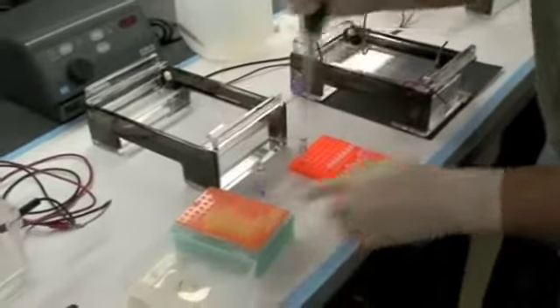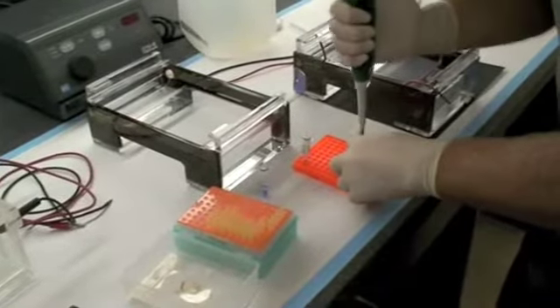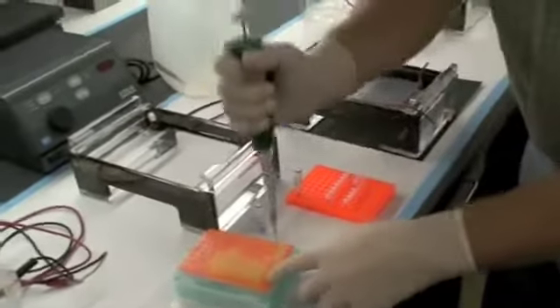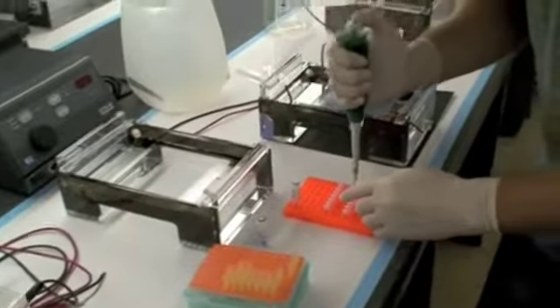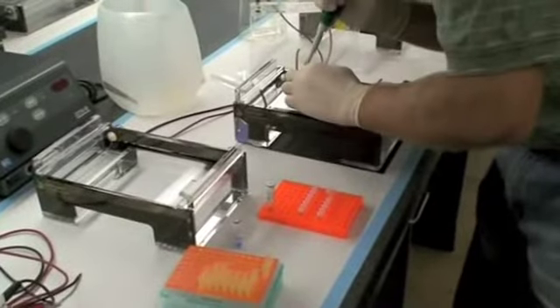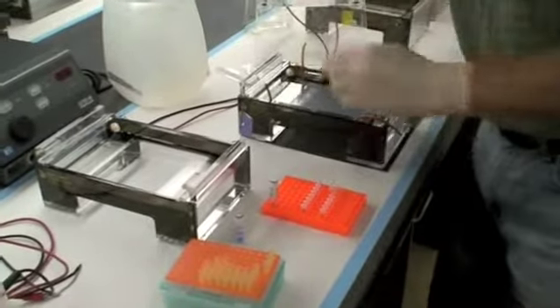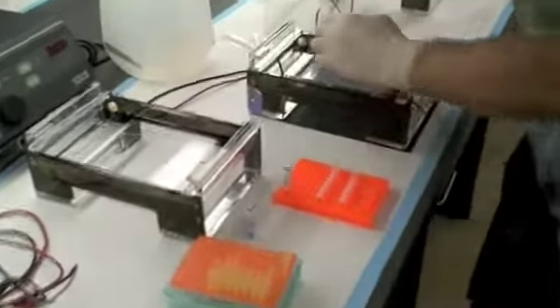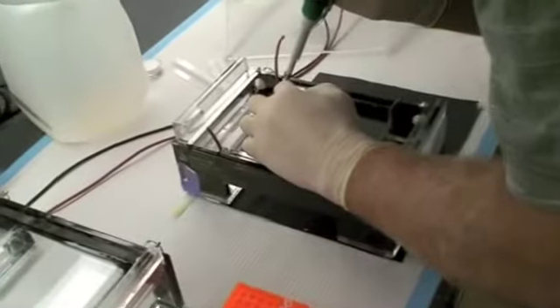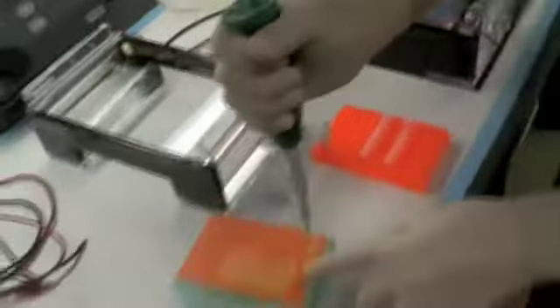And so in any of the parts of this procedure, this is the part where you kind of want to hurry. The longer you wait, the more diffuse your samples get, and consequently your bands. It actually starts diffusing in the gel that colored dye does without any charge.